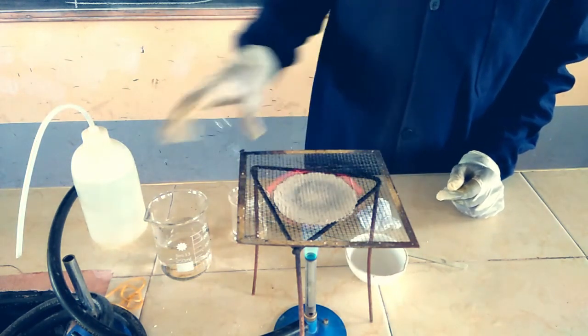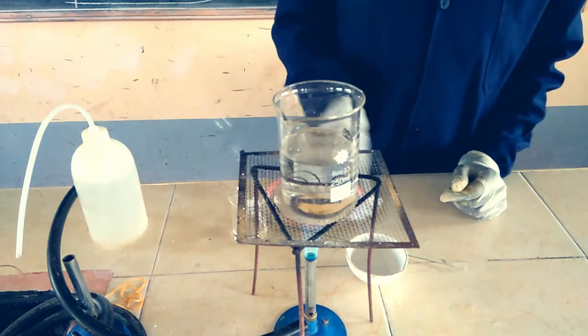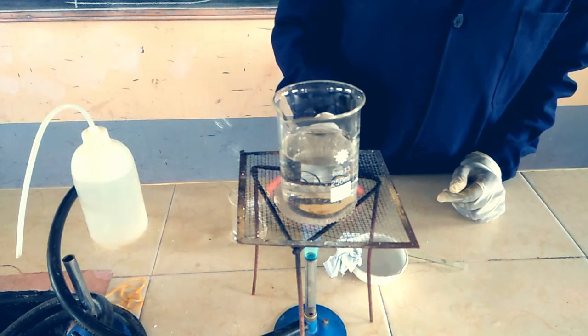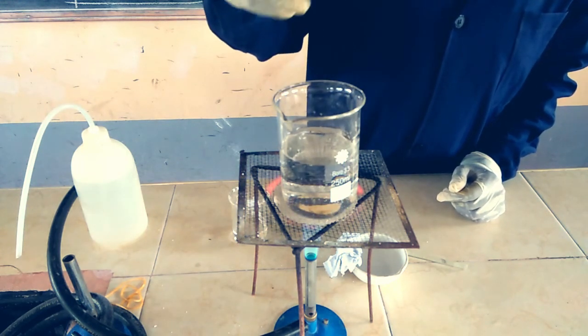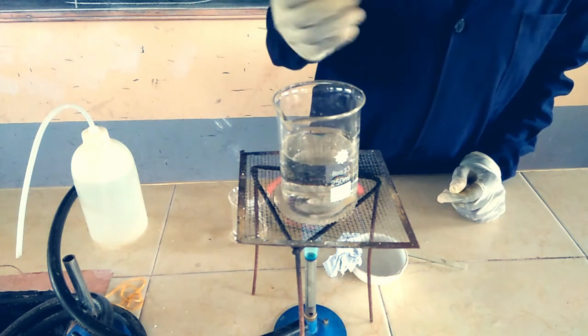Then I'll place the water bath on the flame so it can continue boiling. I had boiled the water initially so it will not take much time to boil. I'd already boiled the water to save time.